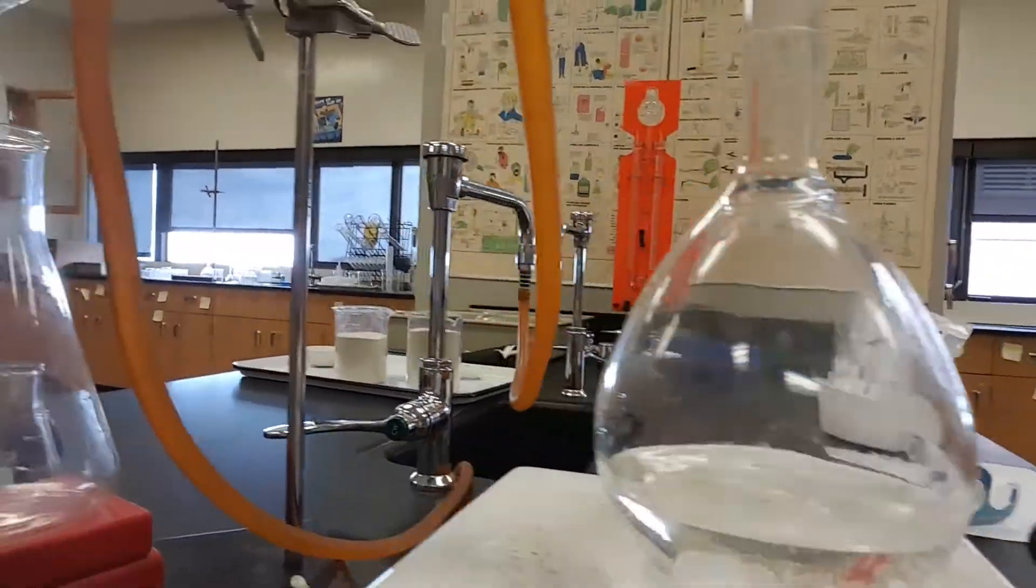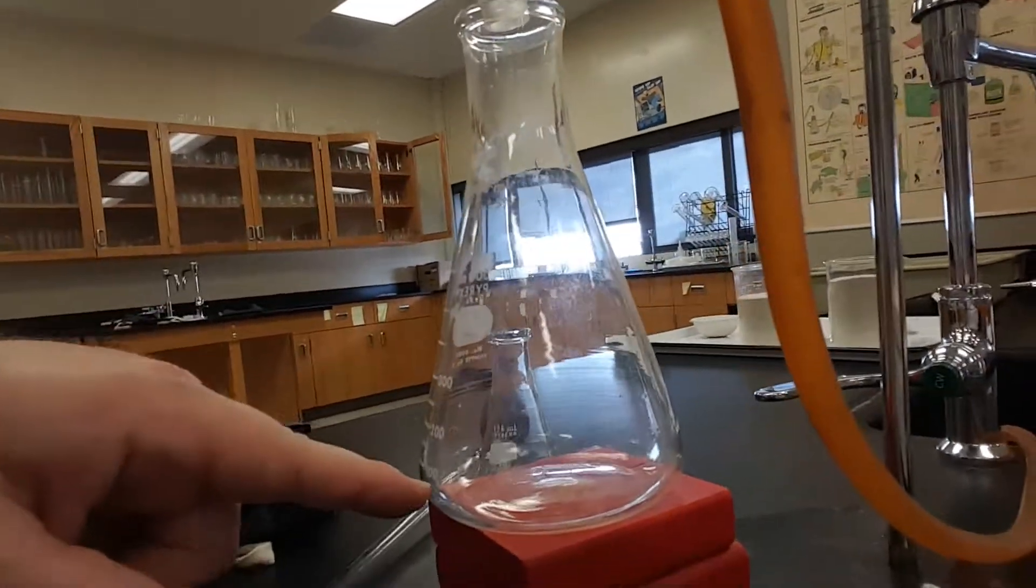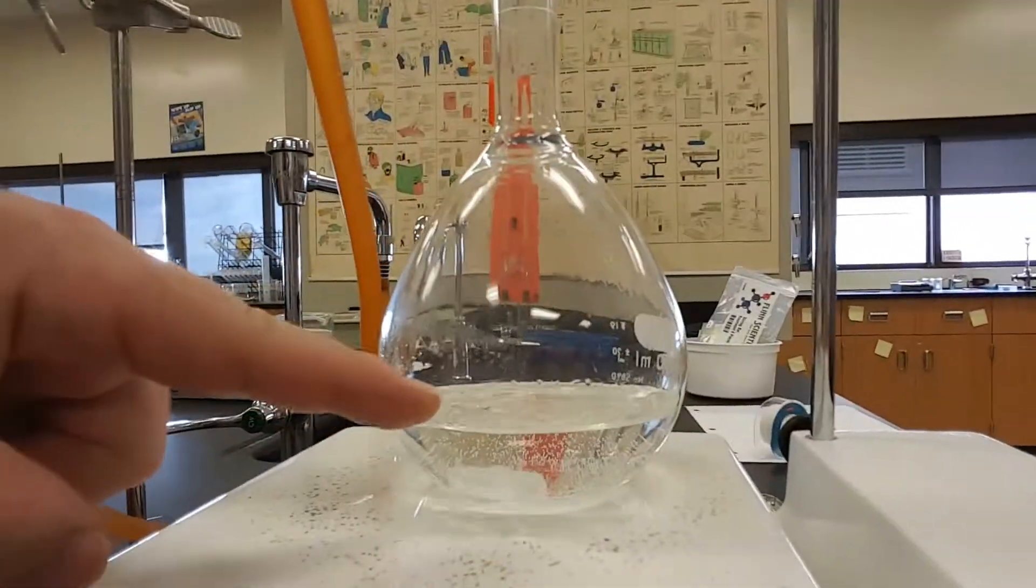We'll have two separate liquids. One left over here, one left over there. Separated by boiling point.